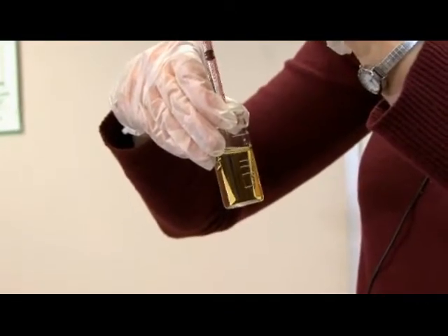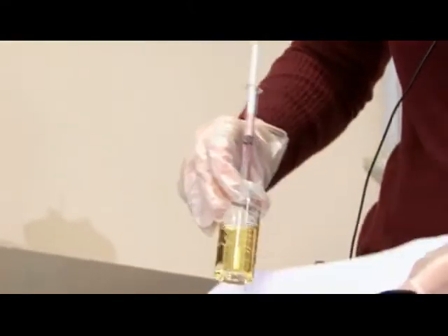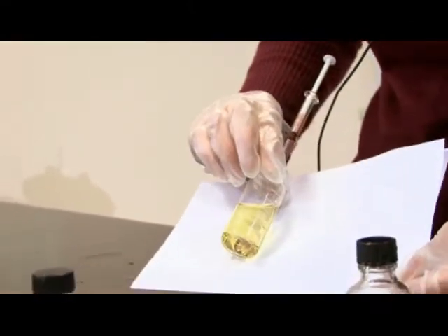And you can see at this point the color is getting a little fainter. I have a pale yellow solution. So I'm going to stop at this point.